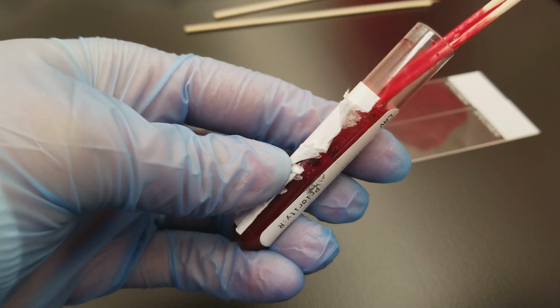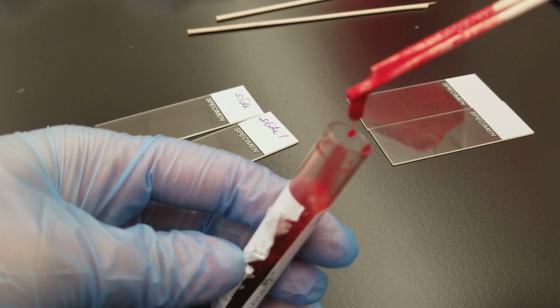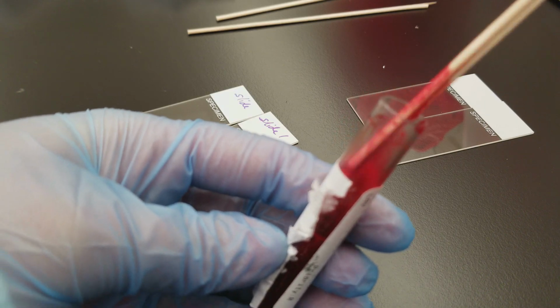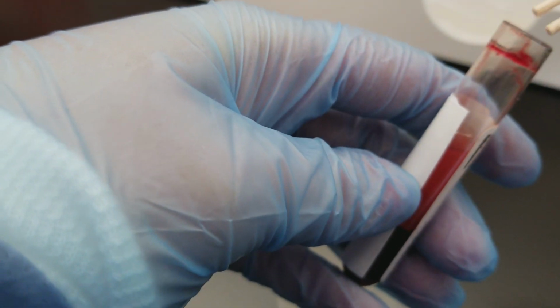And then we would put the drop onto the slide. This one definitely looks clotted, so we're not going to do that. Let me get a different one. Okay, I'm clot checking my second one.